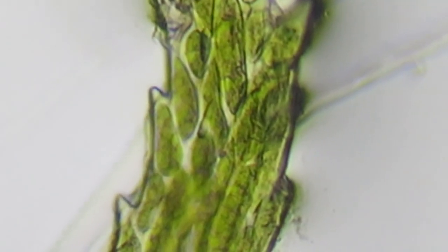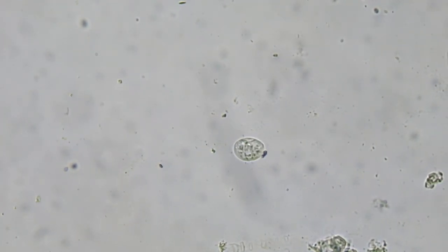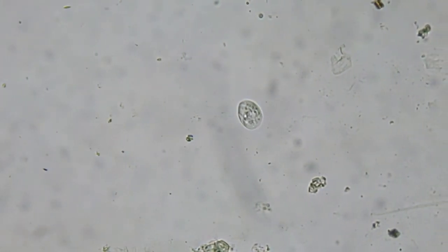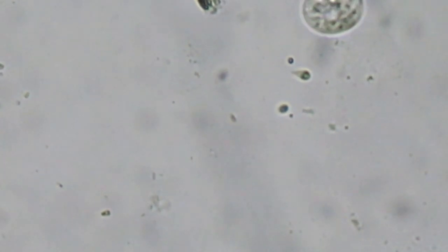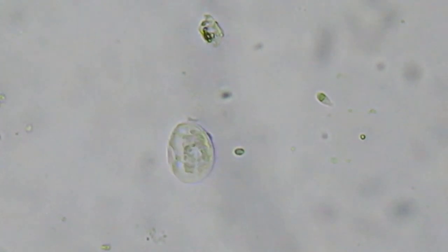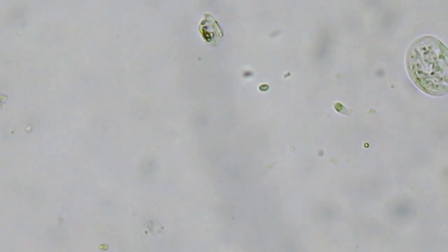I think we're gonna move on to our first organism here. So here we have a little protist and this is a ciliate, which means it has cilia all over its cell which it uses for locomotion and for feeding. While you can't see the cilia here, cilia are like little hair-like structures — they're kind of projections of the cell membrane supported with microtubules. We'll see a closer-up ciliate later where you can actually see the cilia, but we'll just watch this guy scoot around for a bit.